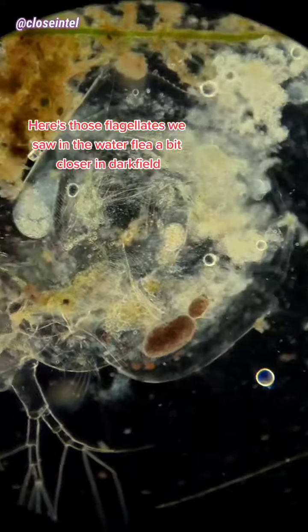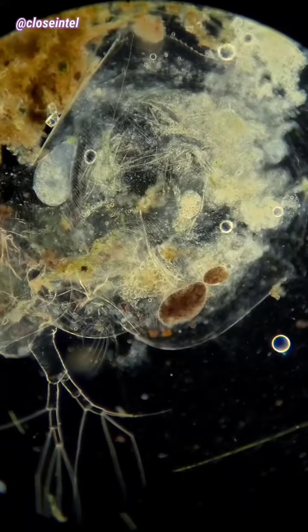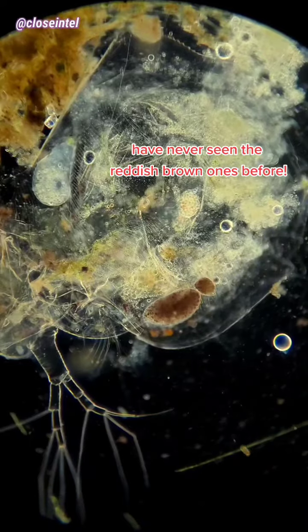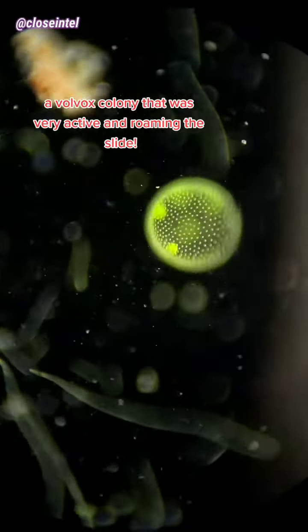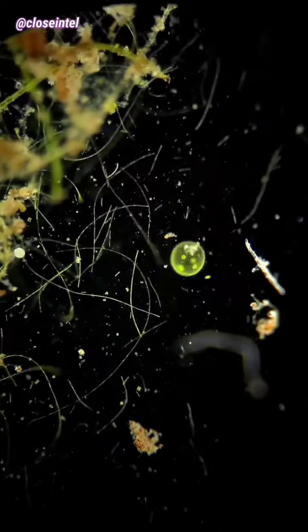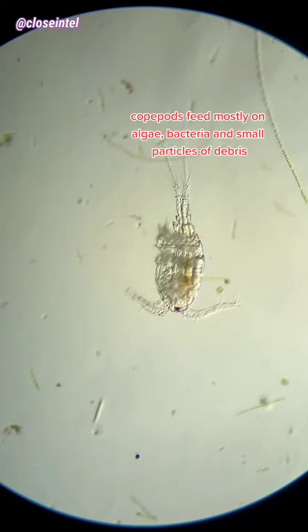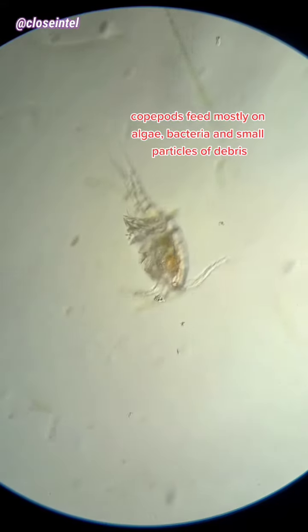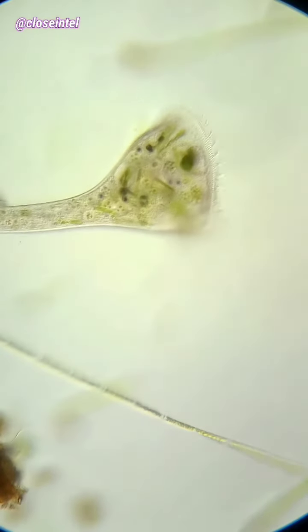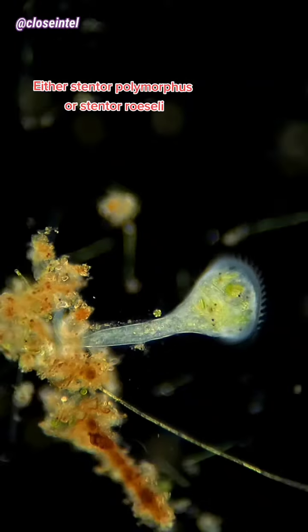Here are those flagellates we saw in the water flea, a bit closer in darkfield. Have never seen the reddish brown ones before. A Volvox colony that was very active and roaming the slide. A copepod — copepods feed mostly on algae, bacteria and small particles of debris. Stentor cell — either Stentor polymorphus or Stentor roeselii.